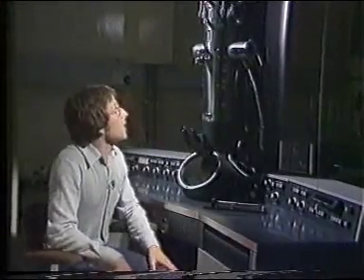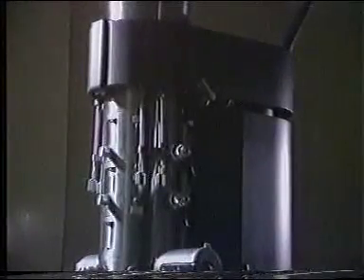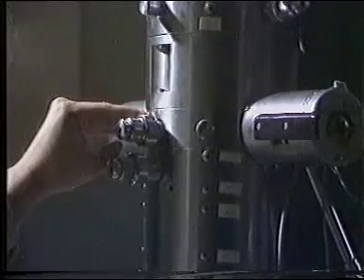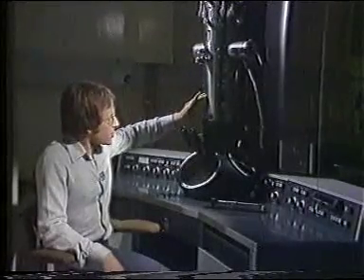The electron microscope looks very complicated, but in principle it's really quite simple. The source of illumination is the electron gun at the top of the column, and when a voltage is applied to the electron gun, a beam of electrons is emitted which passes down the column, and the column's under vacuum because electrons don't travel very easily in air. The electrons are focused by a series of electromagnetic lenses, which are analogous to the glass lenses that we have in a light microscope. The electrons are focused by the condenser lens onto the specimen, which is here. And the image of the specimen is focused by the objective lenses and magnified by the projector lenses.